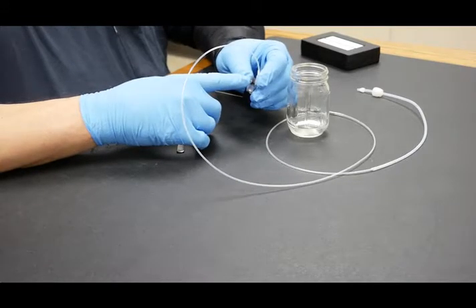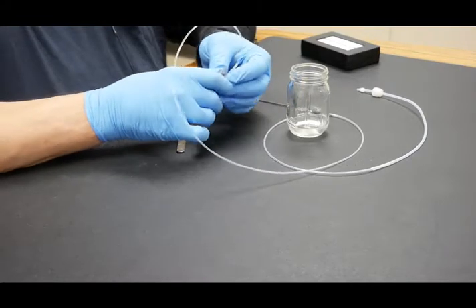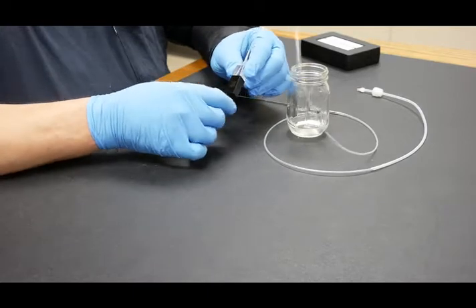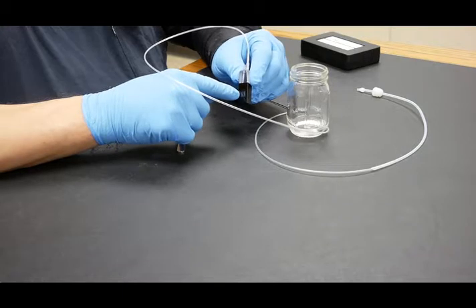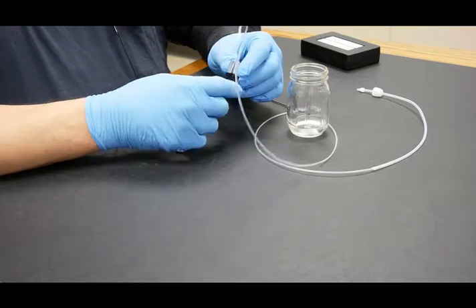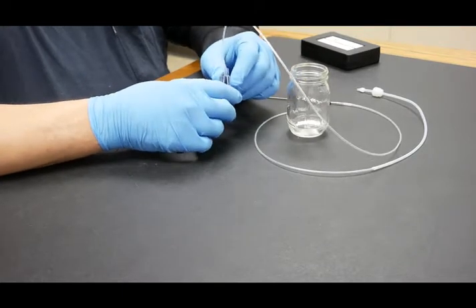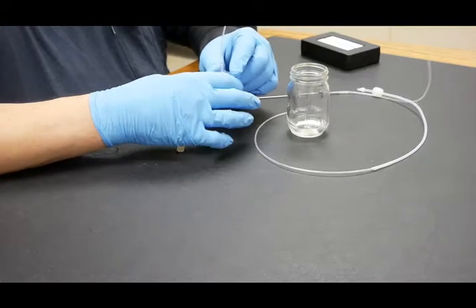Once it's dry, we will do the same thing for the other tube. Notice that on these cells, they have a large aperture on both sides, so we no longer have to place it in the cell holder properly. It can go in either way.